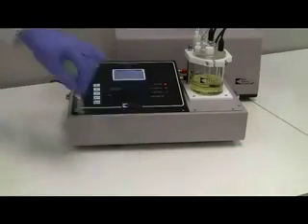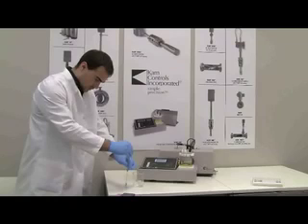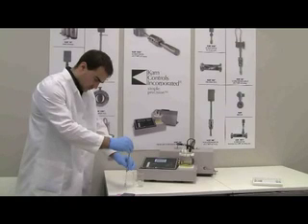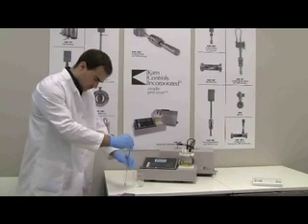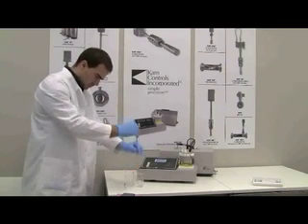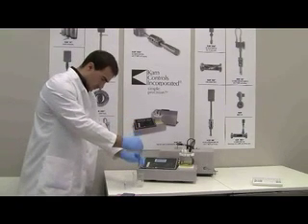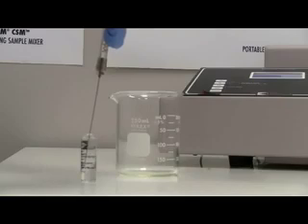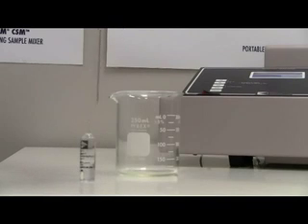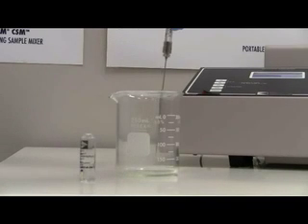Draw some of the sample solution into the syringe and discard into a waste container. Do this three times to fully rinse the syringe and needle with the sample solution. In this case, we are using check solution as the sample.